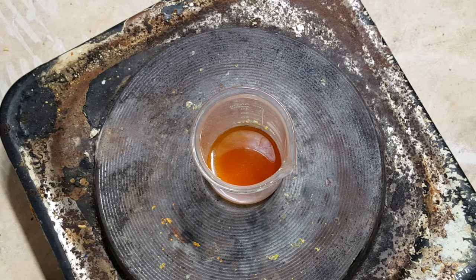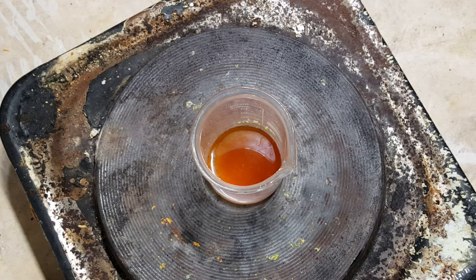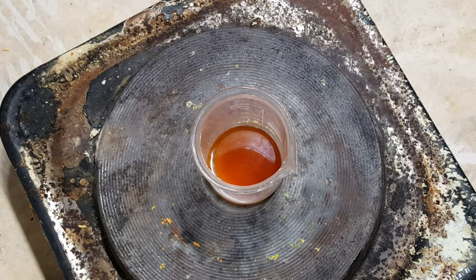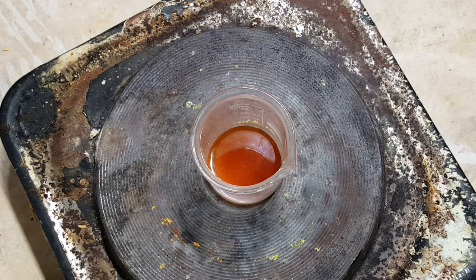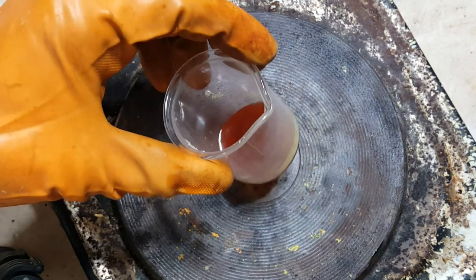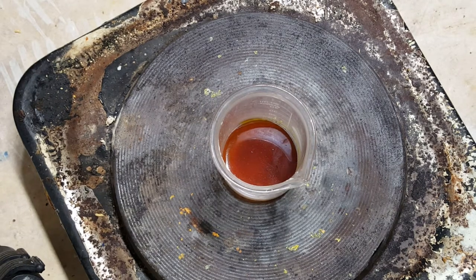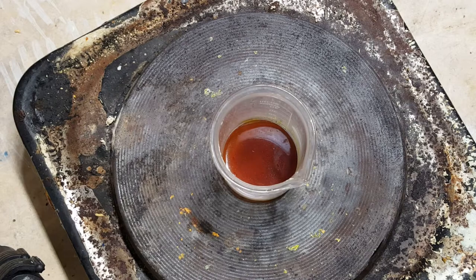The sulfur is now fully molten. As you can see, after further heating the sulfur has begun turning black and becoming a viscous plastic-like substance. Let's turn the heat off. This red liquid sulfur and black plastic sulfur is not stable under standard atmospheric temperature and pressure, so slowly this will convert back into the solid yellow sulfur eight-atom rings.